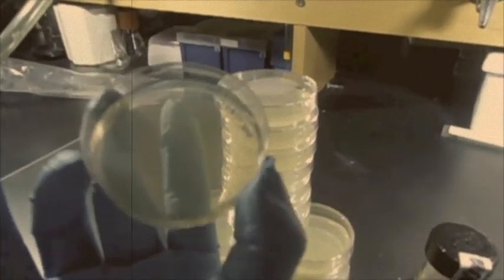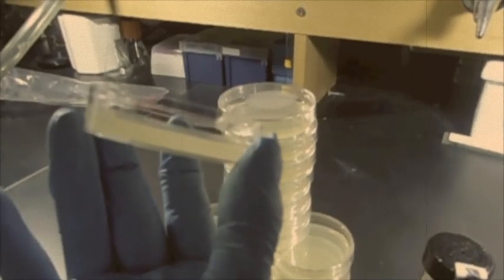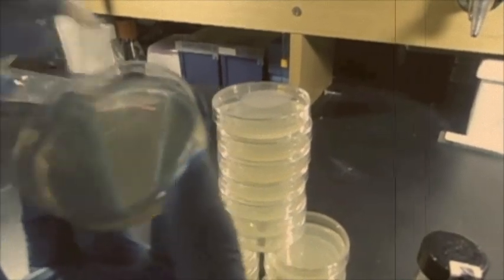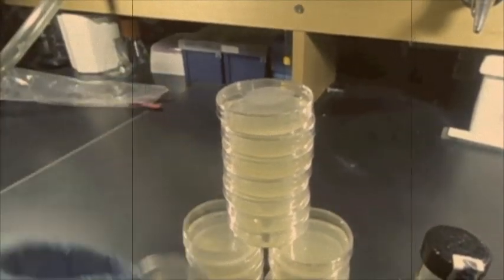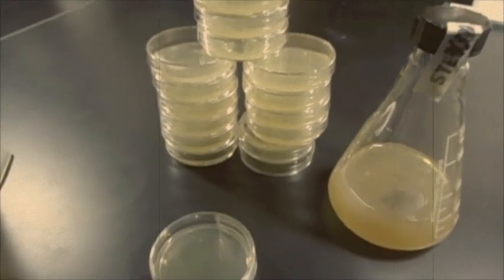Today you will learn how to make LB agar plates. These plates are used as a rich culture media because its nutrients allow organisms from the invisible world to grow.